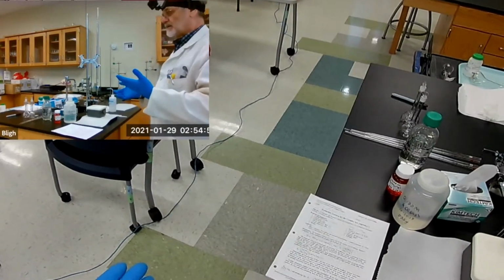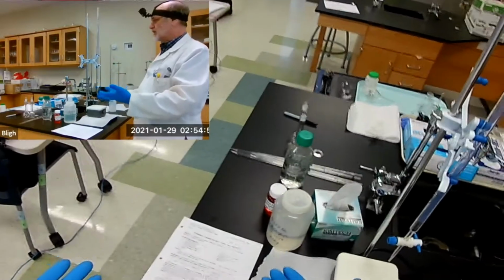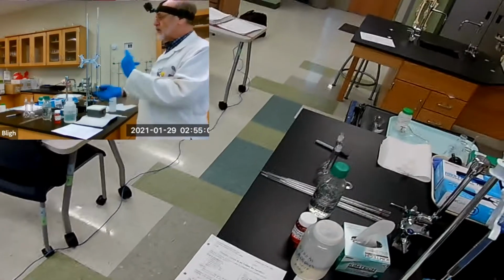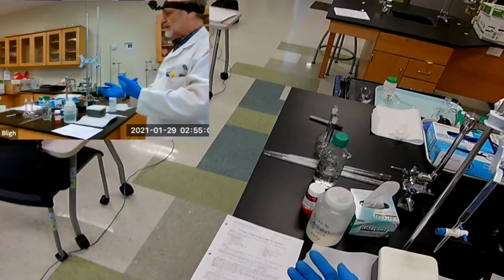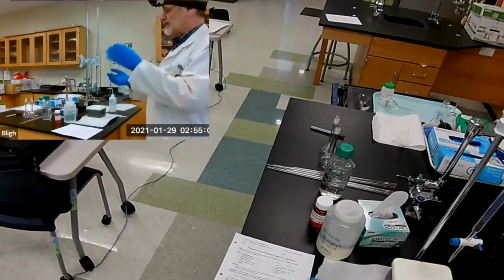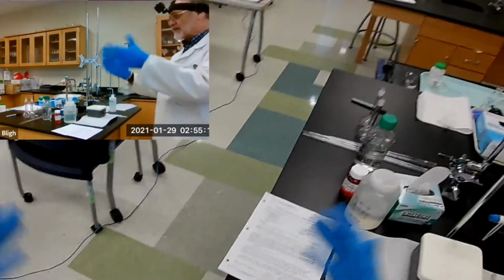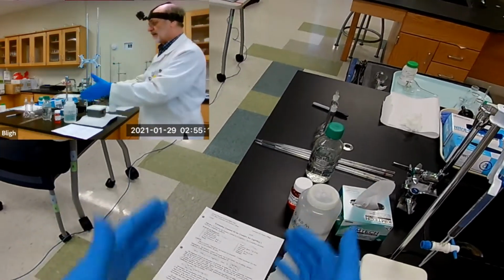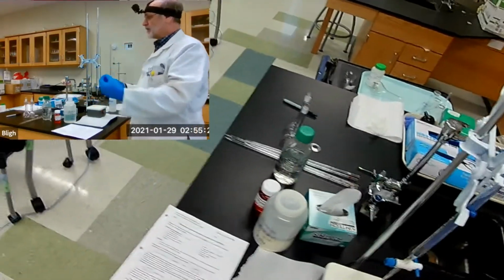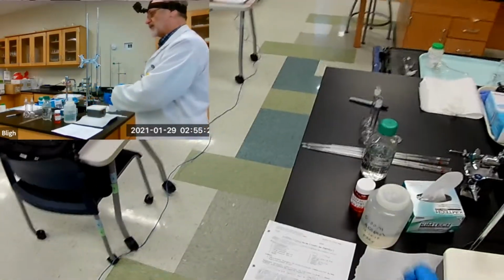But as you know, whenever you have even a solid precipitate in a solution or a complex ion which is not precipitated, there's an equilibrium in one case, the silver chloride and the silver ions and the chloride ions in solution. And there's also, in that same environment, the way we've set it up, an equilibrium between free silver ions, free ammonia molecules, and the complex ion.